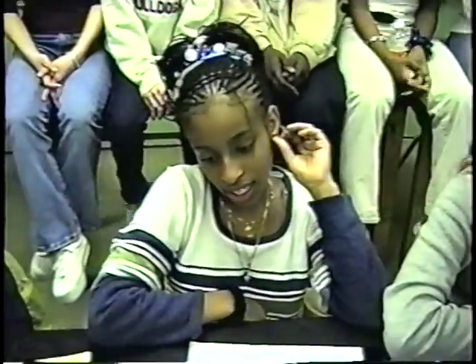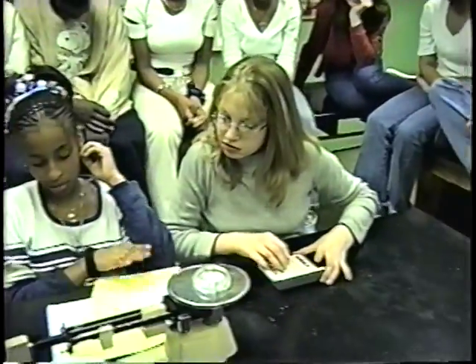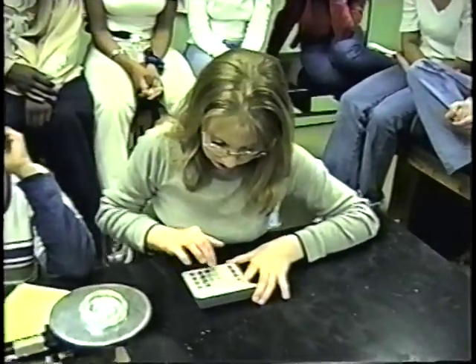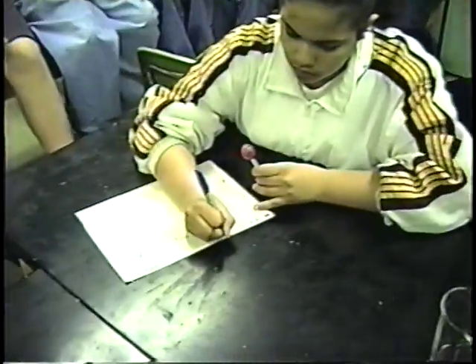And what'd you get? 89.4. Okay, now if she wanted to know what the contents of that container weighed, mathematically, what does she have to do? That brings it over to Jen. Jen, plug in those two numbers and tell us the difference. 7.7. And write down next to number of grams, 7.7.